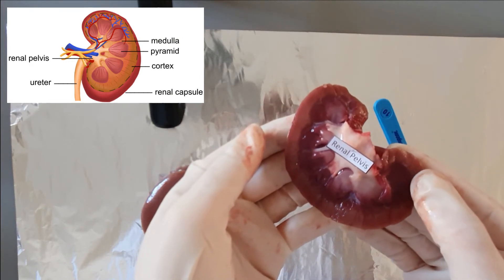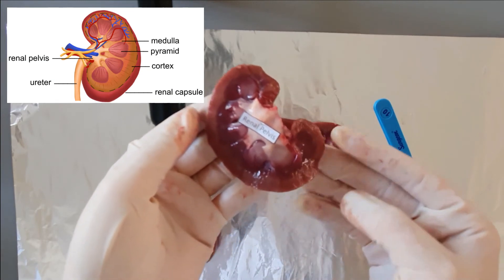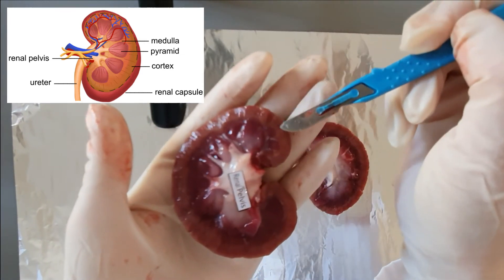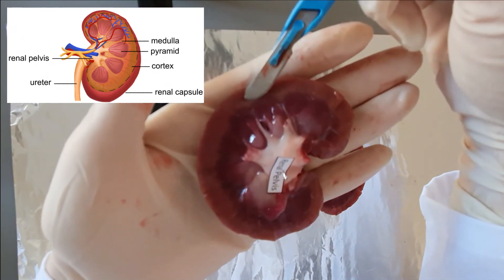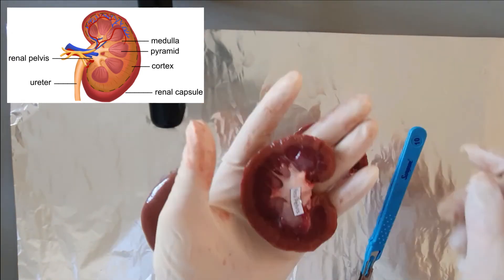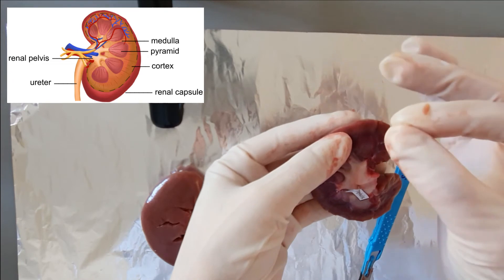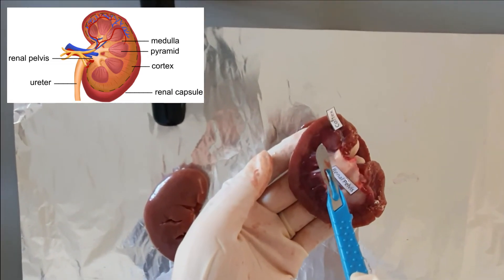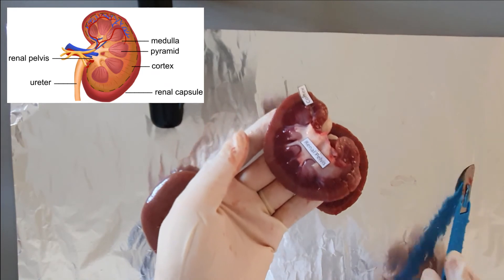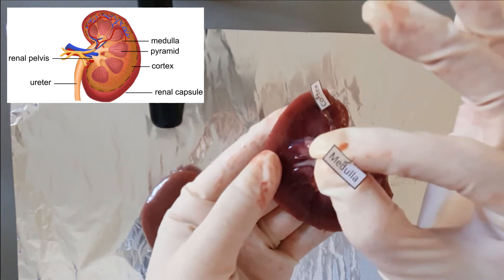The renal pelvis is also the exit point for the ureter and it connects the kidney to the rest of the body. The kidneys are surrounded by a renal cortex, which is the space between the medulla and the outer capsule. The medulla is the inner region of the kidney and consists of multiple renal pyramids, which are triangular structures that contain a dense network of nephrons.